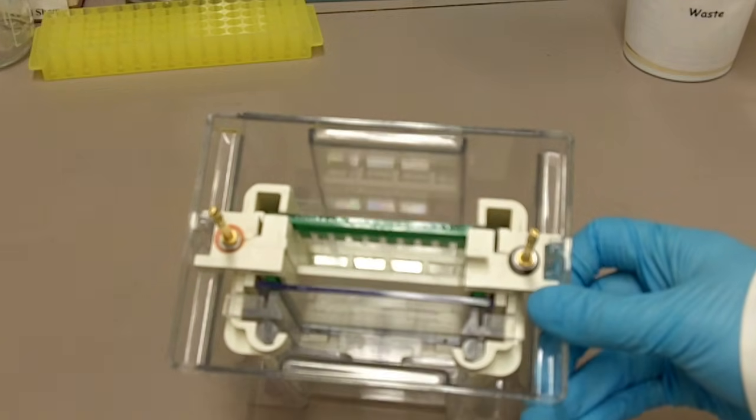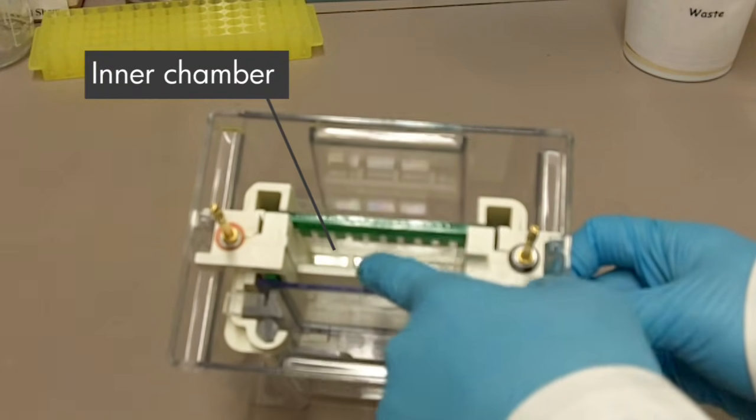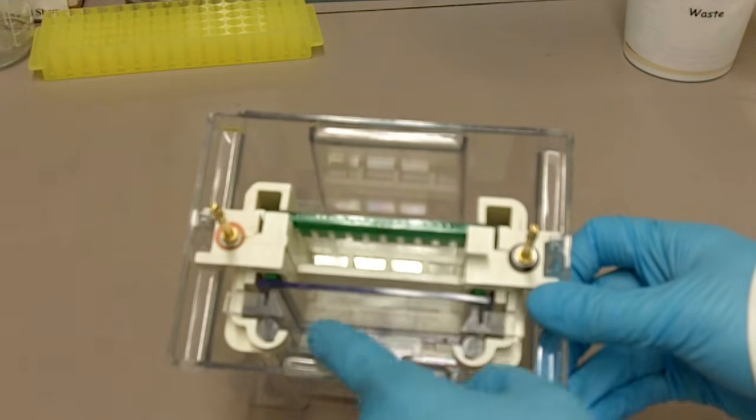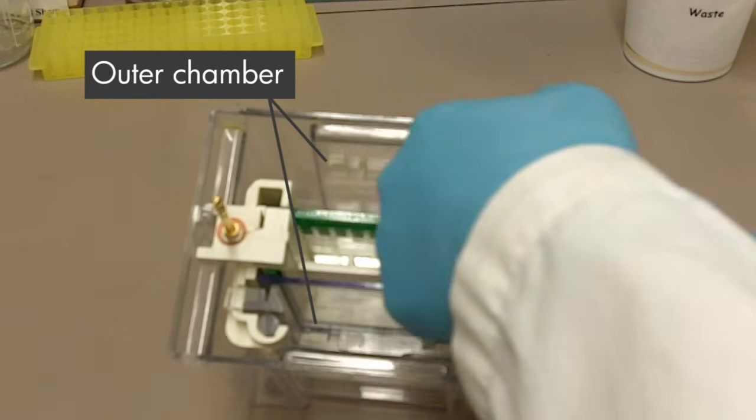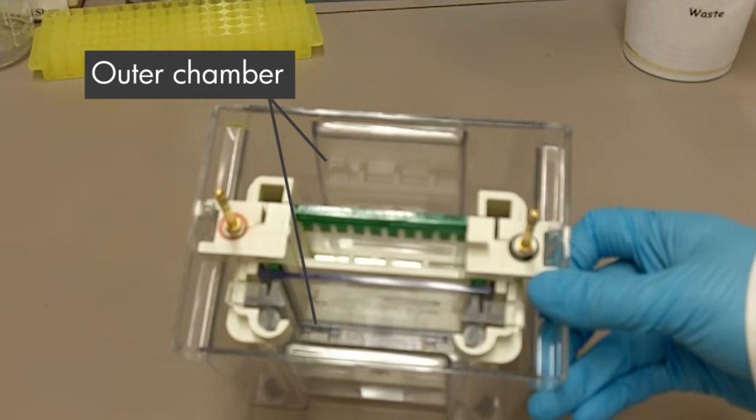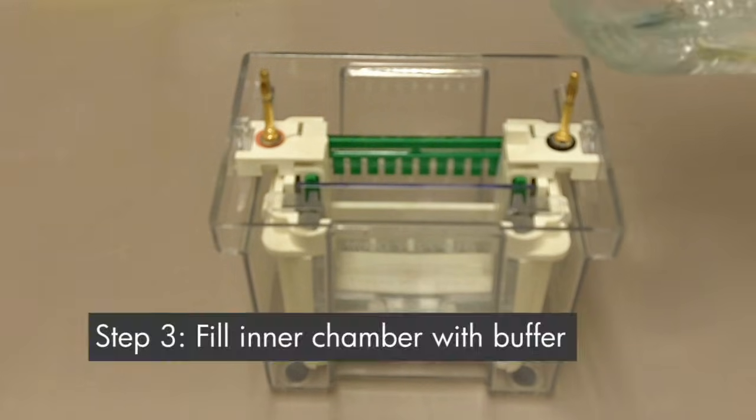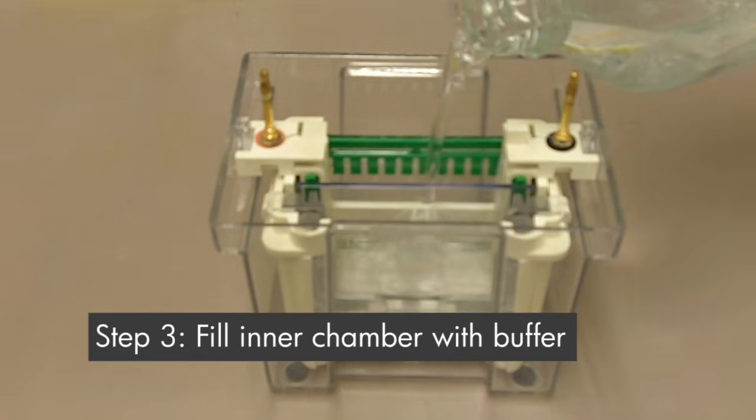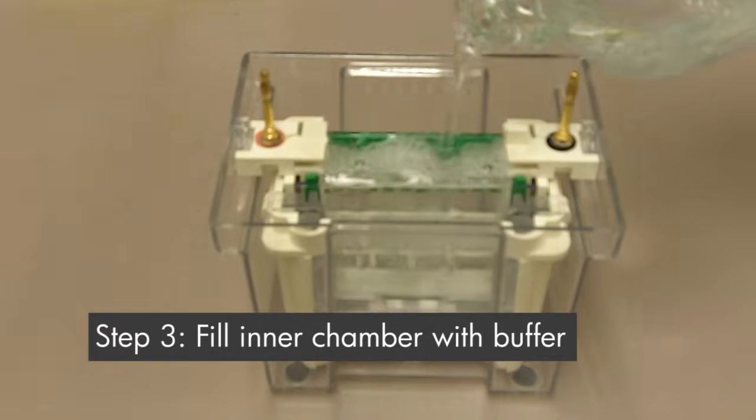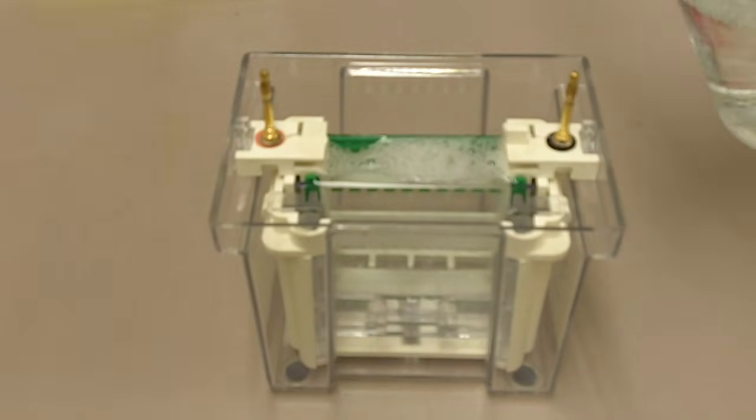Right now, if you look closely, you can see that this is the inner chamber here and there is the outer chamber. What you have to do right now is fill the inner chamber up with buffer. So we'll fill the inner chamber all the way to the top with buffer.